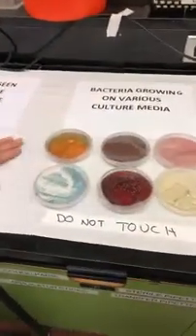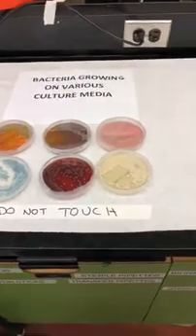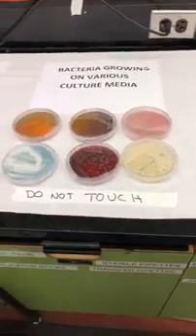We use a lot of different media in microbiology in order to differentiate between the pathogens, and depending on where they come from, we choose different media. If it's a throat swab we might choose one thing; if it's a stool sample or a blood culture we would choose something else. So we have lots of different coloured media, and the students learn all about how to use them and when it's appropriate to use different types.